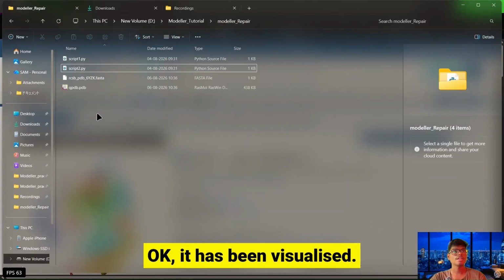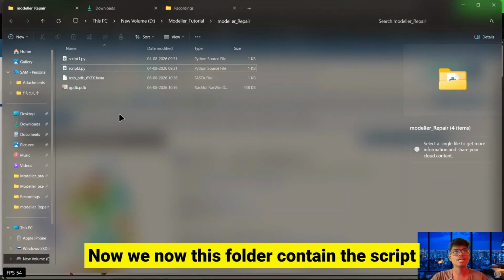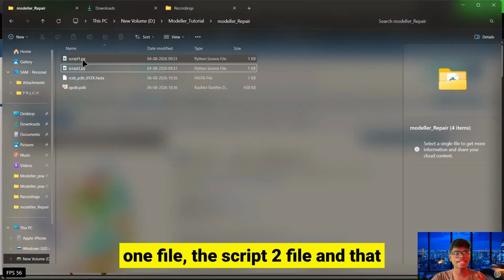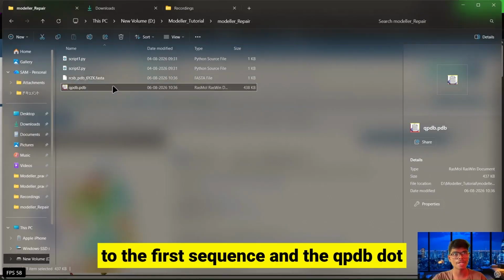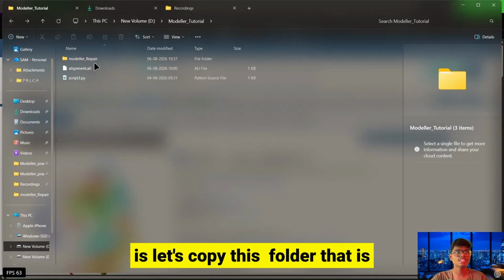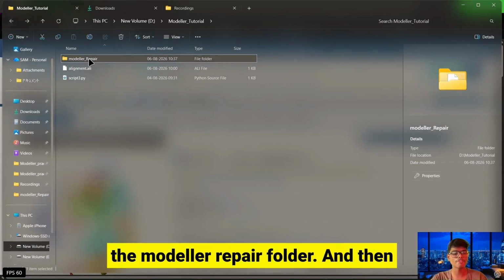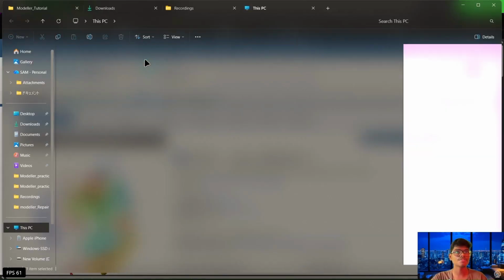Okay, it has been visualized. Now this folder contains the script1 file, the script2 file, the FASTA sequence, and the qpdb.pdb. Now the next task is to copy this folder, that is the modeller repair folder, and after that we have to move to the C drive.